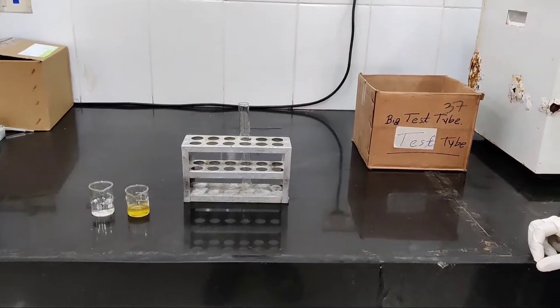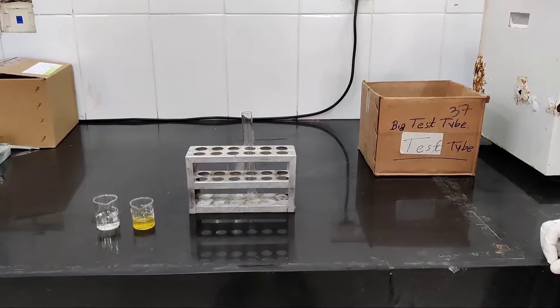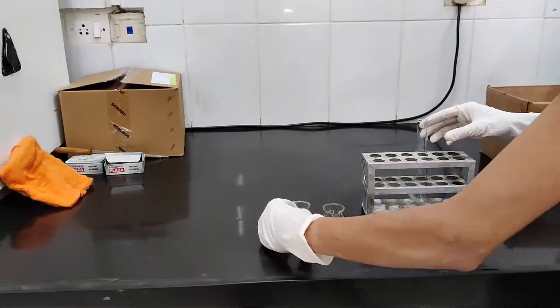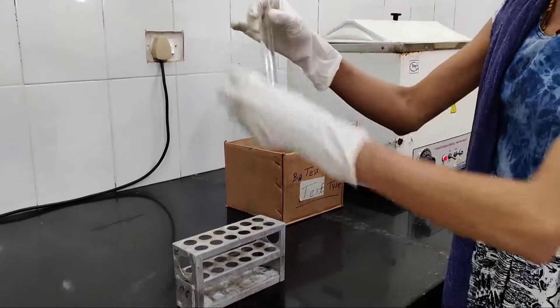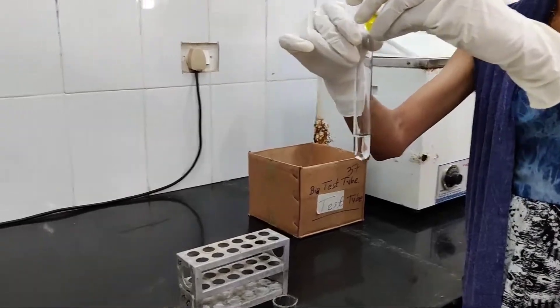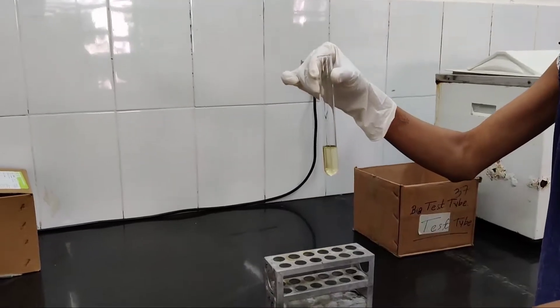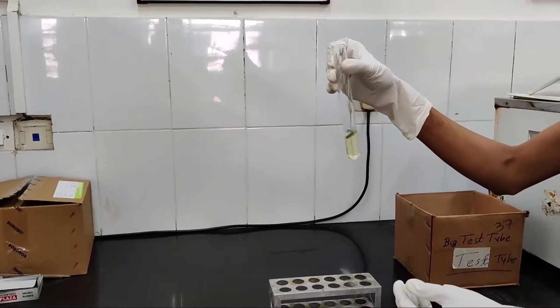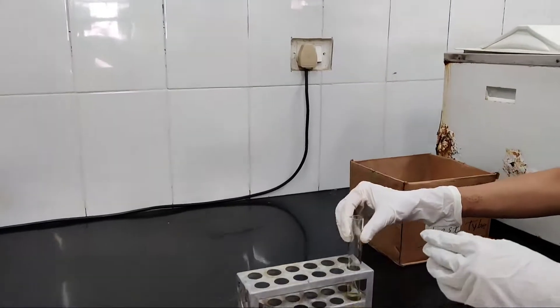Now we will see the demonstration of the osazone test in the laboratory. First, take 5 ml of carbohydrate solution in a test tube. Then add 3 ml of osazone buffer, which contains phenylhydrazine hydrochloride, glacial acetic acid, and sodium acetate. After adding the osazone buffer, mix it properly, then apply cotton wool on the top of the test tube.